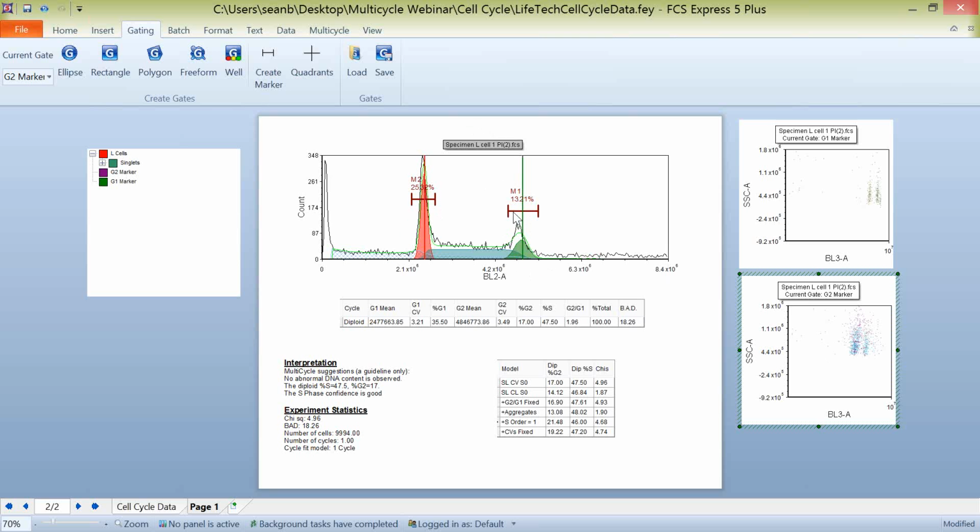But if you do need to get into the data a little bit further, you can use the breaks from our modeling here to set where these G1 and G2 markers are going to be and apply that to any other plots that you'd like to in the analysis.